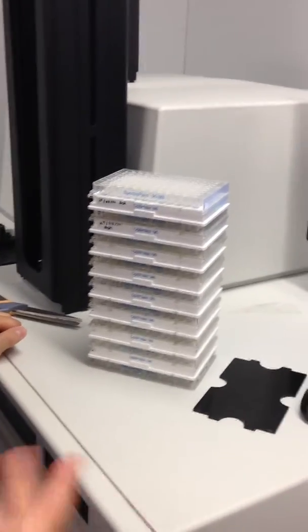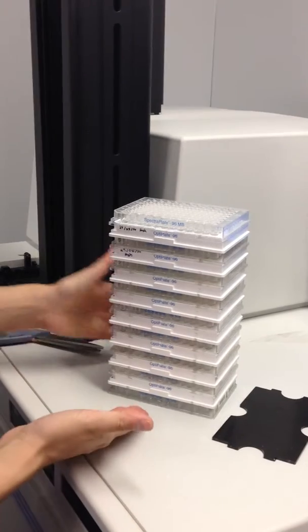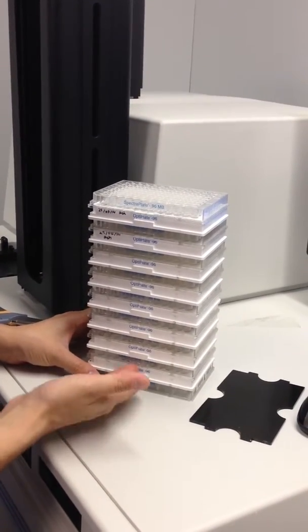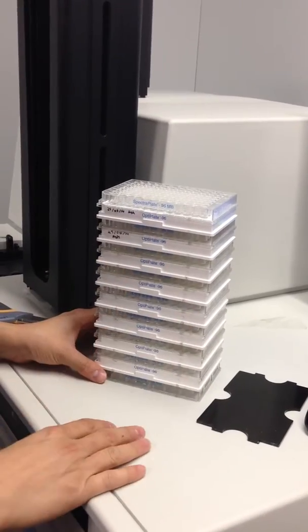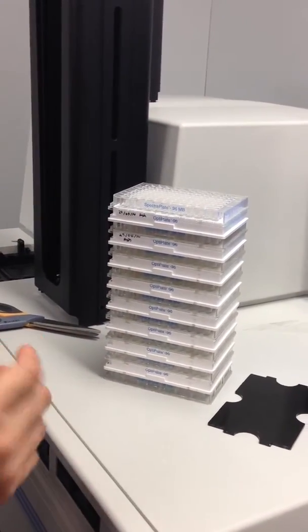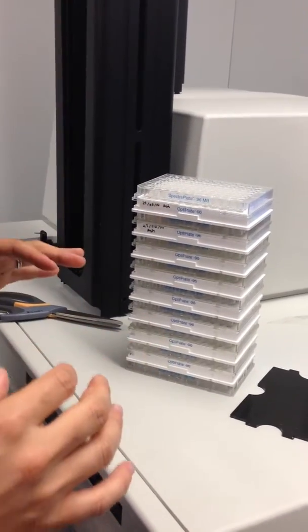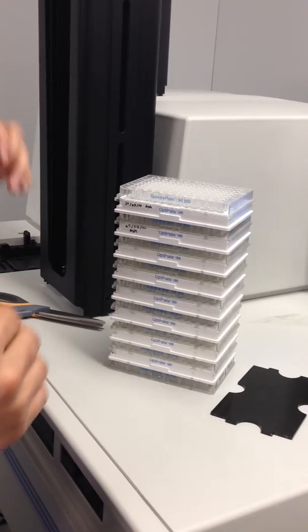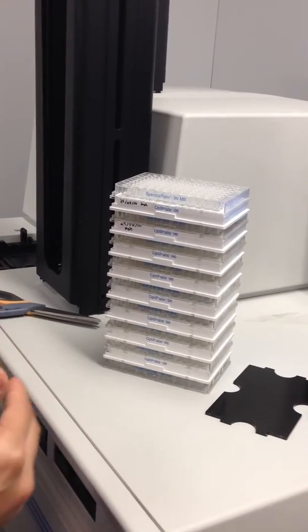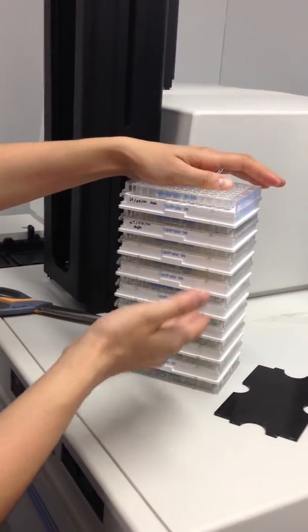Okay, in the meantime, things that you can do while waiting is set up your plates. You always start with a spacer plate, which is a clear plate, and then you alternate actual plates. The way the assay is set up right now, and by assay we mean the parameters that the software is going to use to sample data, is that it can skip plates. It doesn't read each one.